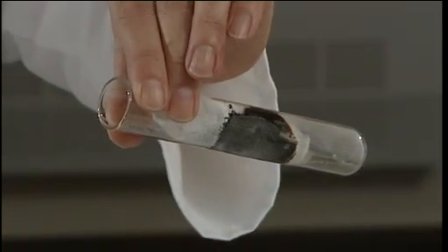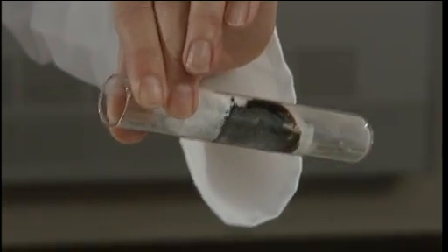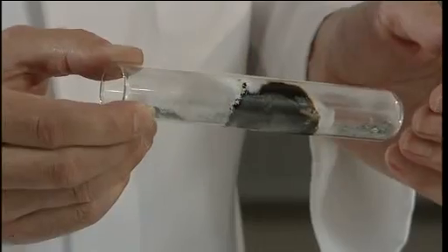After five or ten minutes, the tube will have cooled and the next step is to remove some of the things that we don't want that are in amongst the silicon. The mixture in the tube now contains magnesium oxide and magnesium as well as some magnesium silicide.